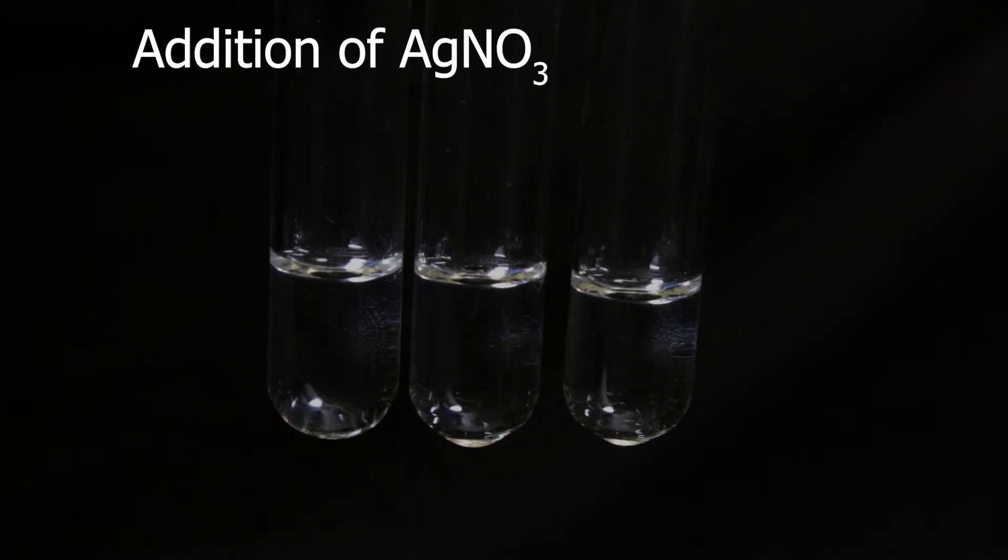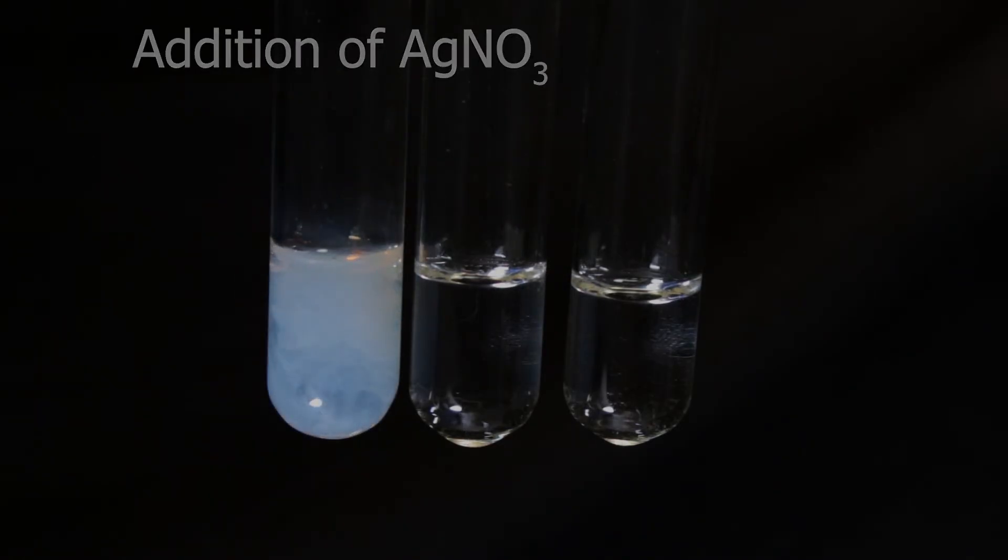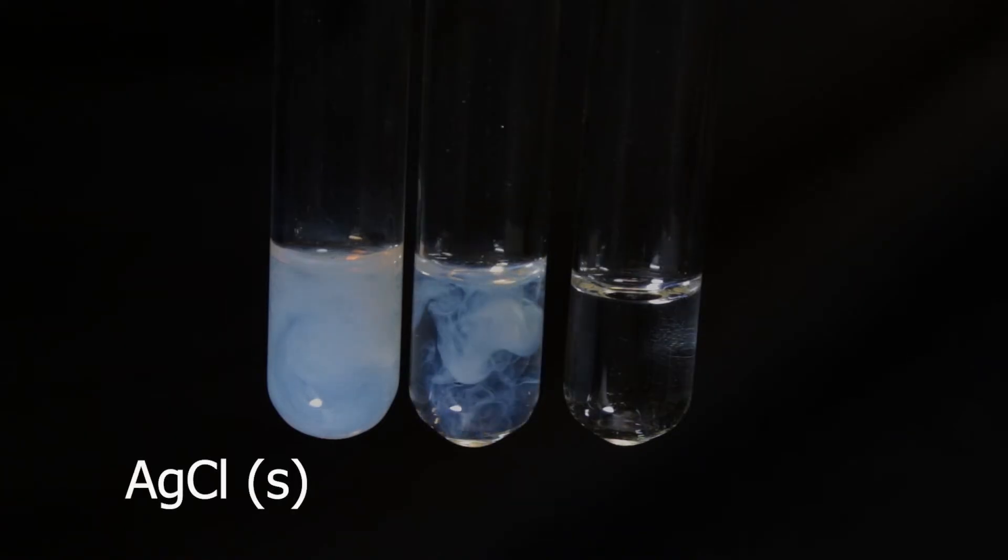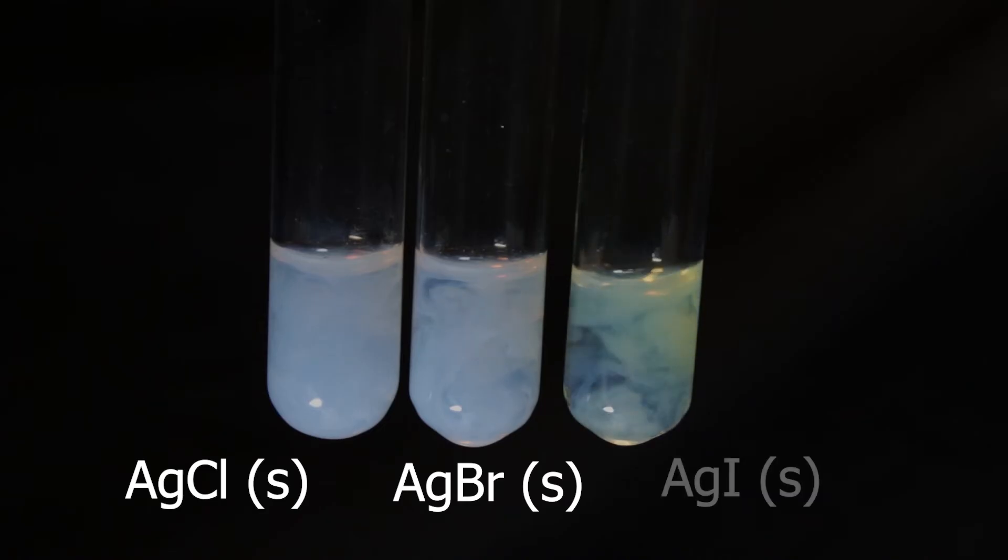I prepared the solutions of the salts. Chloride first, bromide in the middle, and iodide in the right. Here are precipitates. But you see the colors are pretty similar.